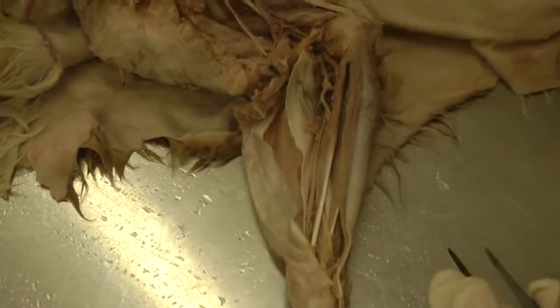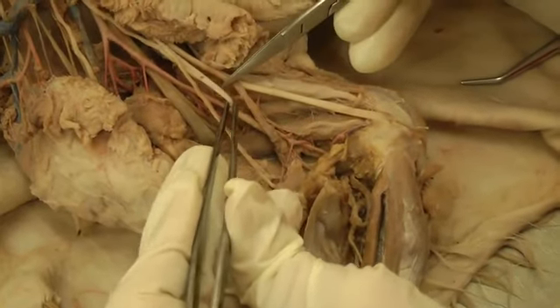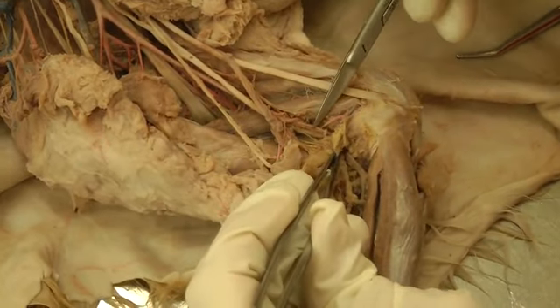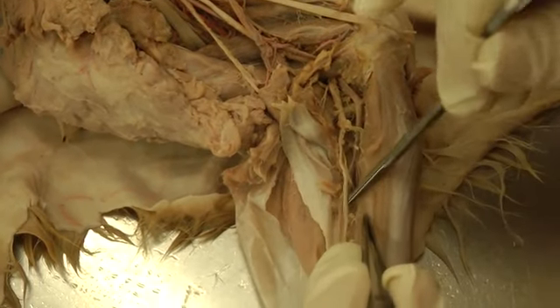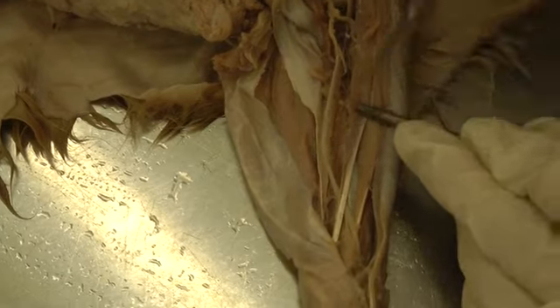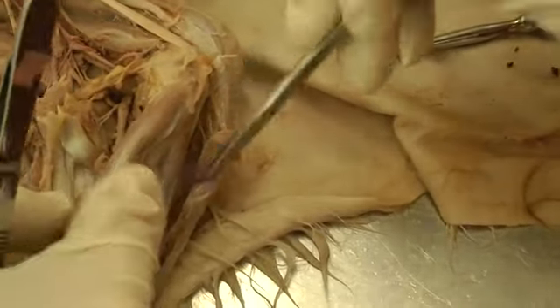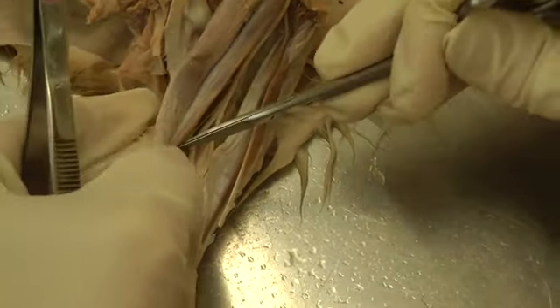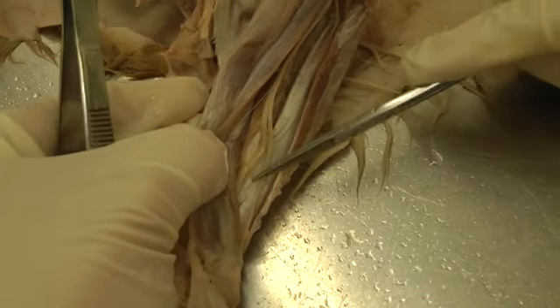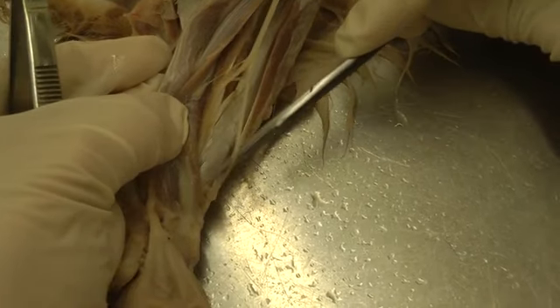For the nerves: the median nerve travels with the brachial artery through the supracondylar foramen, coming out and traveling along that artery here. Then we have the ulnar nerve coming down — cut the muscles if you need to — following the ulnar nerve down on the caudal aspect.